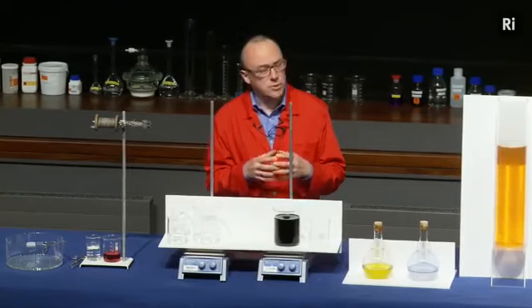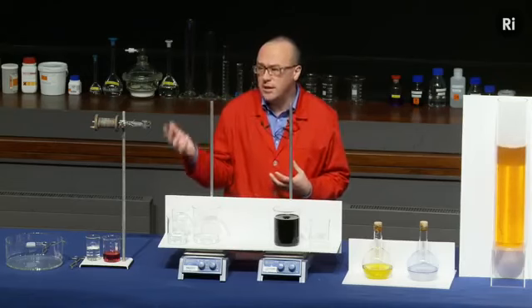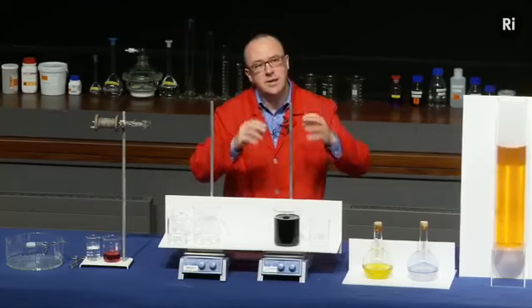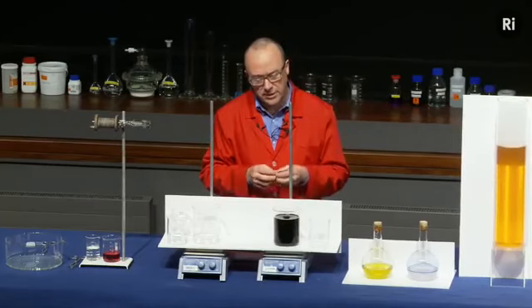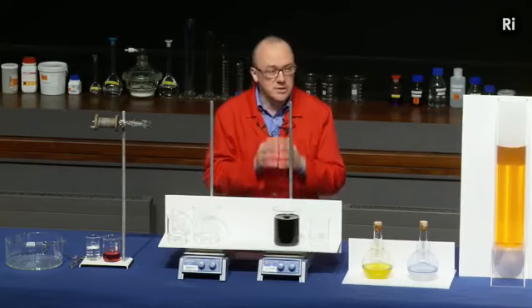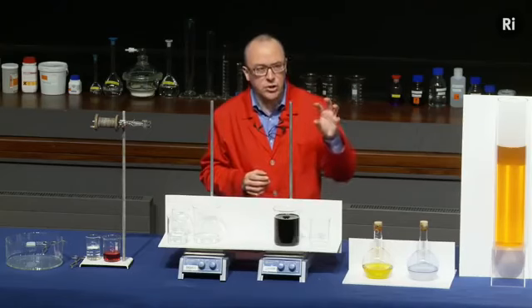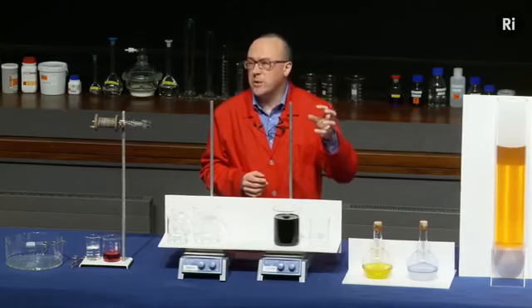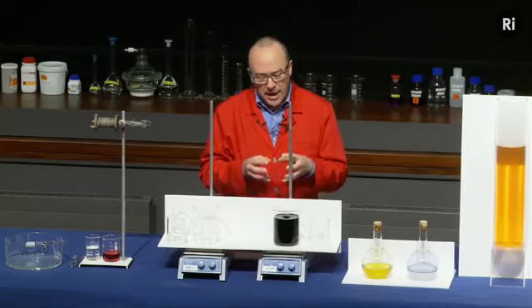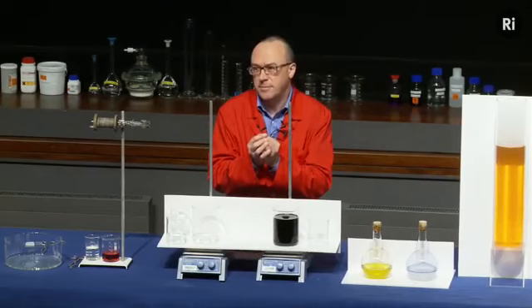The first reaction was quite a slow reaction. It was a reaction between two chemicals that produced iodine. So you imagine this reaction taking place and slowly releasing iodine into the solution. Now the iodine would appear as a sort of brown colour. You can't see the iodine because there's a second chemical reaction taking place. There's a material in the solution which is reacting very quickly with the iodine, and it's absorbing the iodine as soon as it's produced. And the secret to this is to arrange that second material is in short supply.